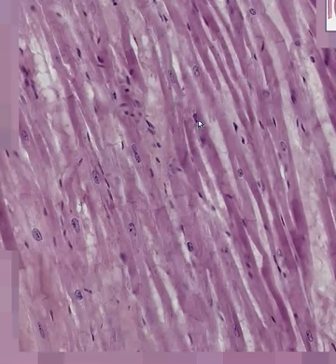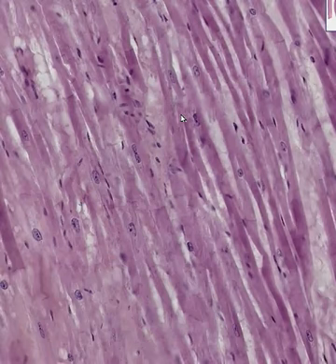Perhaps I could convince you that if you look very closely, like here, or perhaps here, or let's go to another place. If you can't see it well, just take a quick visit to another place. If you look perhaps here, hopefully, I can convince you that these are striations also.